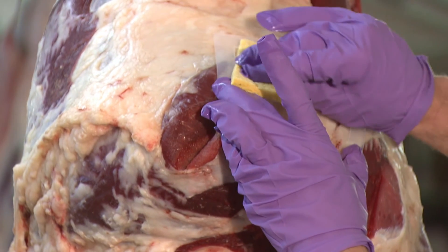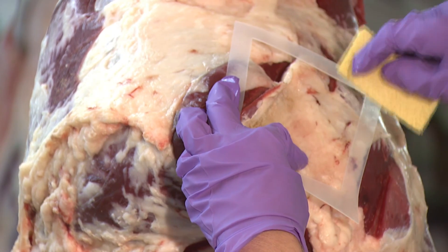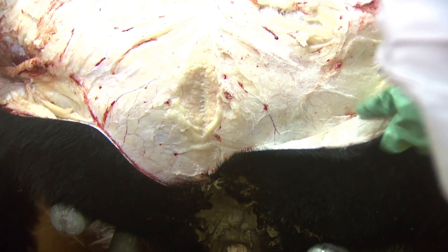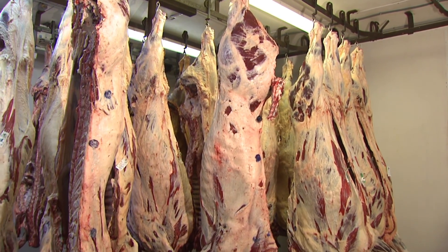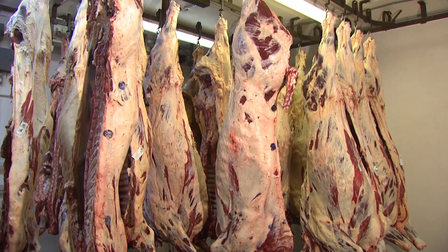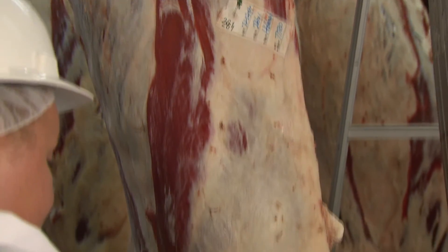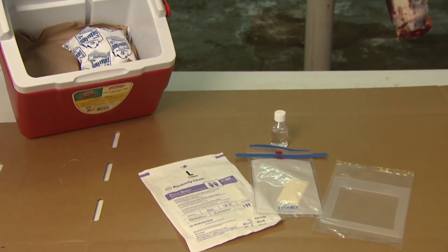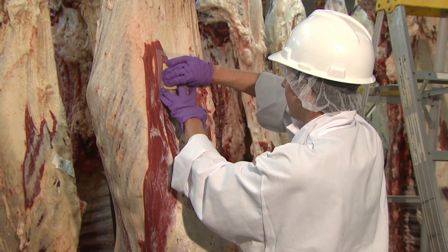Every beef slaughter establishment is required to test for Escherichia coli biotype 1, also known as generic E. coli. Generic E. coli is common in the intestinal tract and on the hides of all beef cattle, so it can be used as a process control indicator for carcass fecal contamination. Therefore, testing for generic E. coli is used to verify the effectiveness of an establishment's food safety practices for beef slaughter. The objective of this video is to discuss standard procedures for the testing of beef carcasses for Escherichia coli biotype 1.